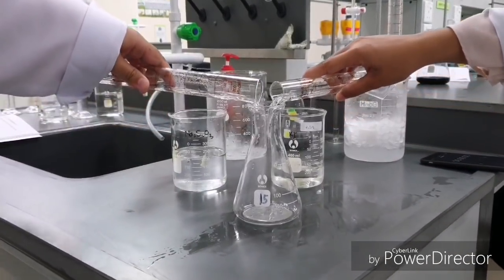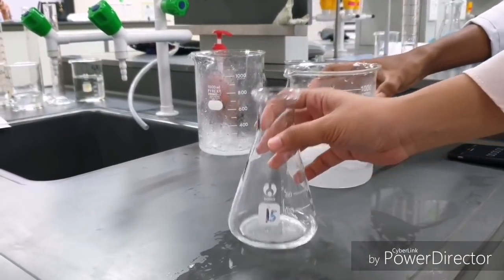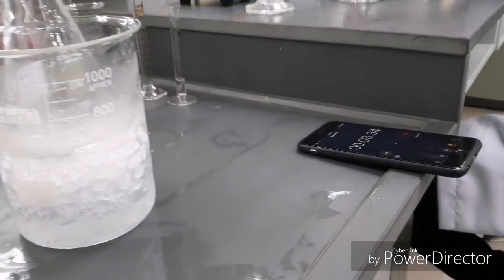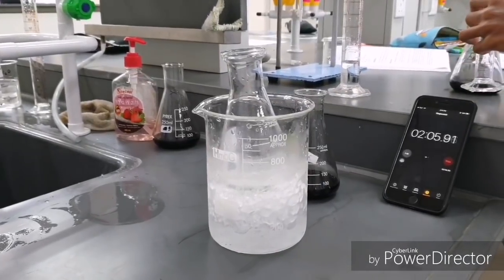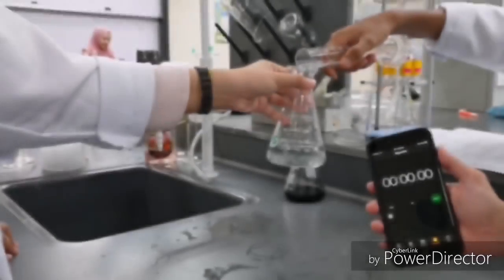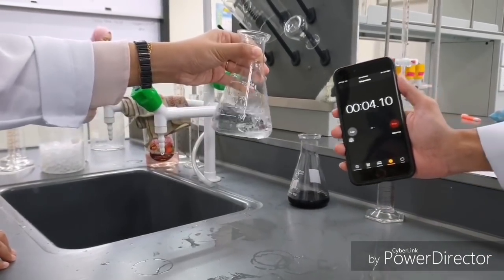For this run, use the reference reaction mixture. Before adding the peroxydisulfate, warm the mixture containing iodide and thiosulfate using a hot plate or cool it using an ice bath, and let it sit for about 5 minutes. In the meantime, while waiting for the solution's temperature to drop, we recommend cleaning up the working place. After the 5 minute mark, remove the conical flask containing the solution from the ice bath. Begin timing as soon as the peroxydisulfate is added, and immediately swirl the reaction to ensure good mixing.